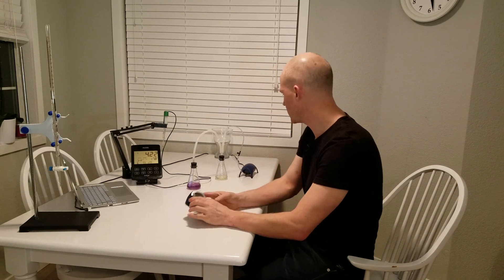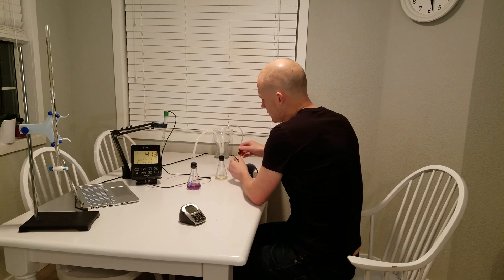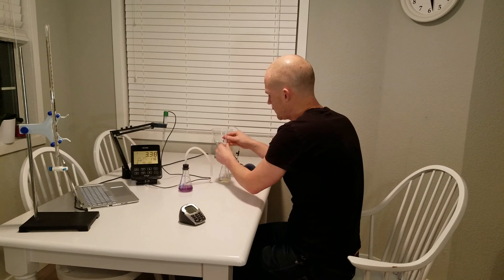Alright, that's our 15-minute timer. We're going to go ahead and unplug the pump, turn it on for next time, and we're now done with our wine. I'm going to unplug here — make sure not to tip it over.